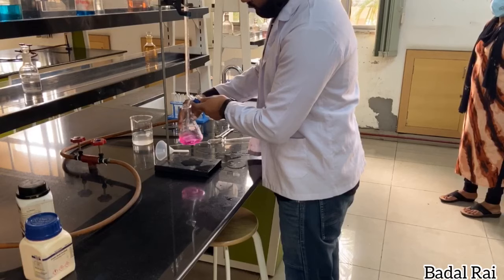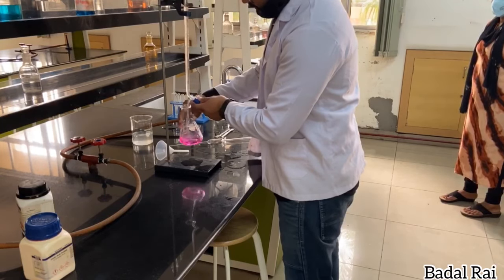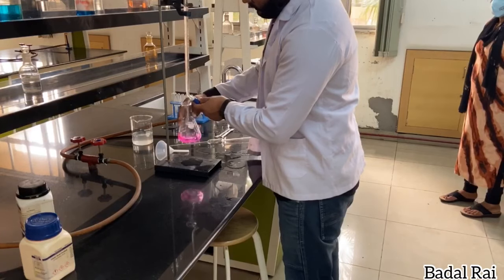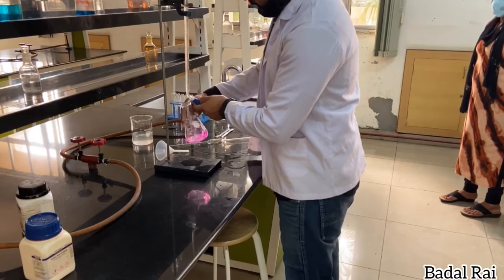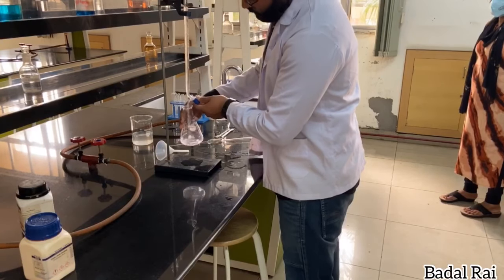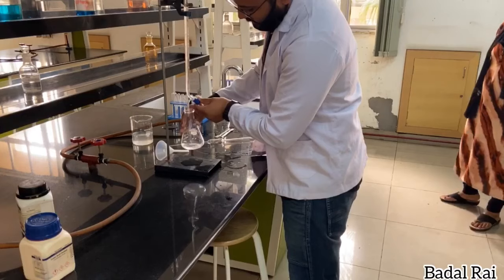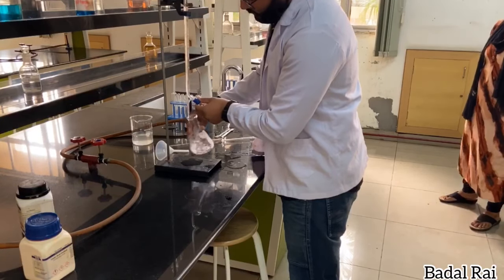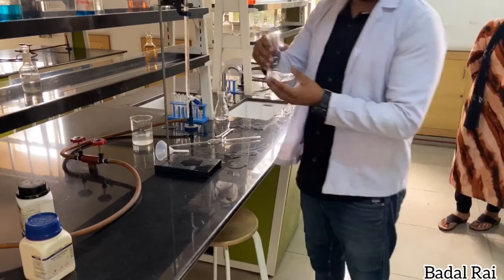We will fast forward the video to show you the final result. We keep adding oxalic acid dropwise with continued stirring using one hand. See how I stir it — and as soon as we reach the endpoint, the solution becomes colorless. There it is — colorless.